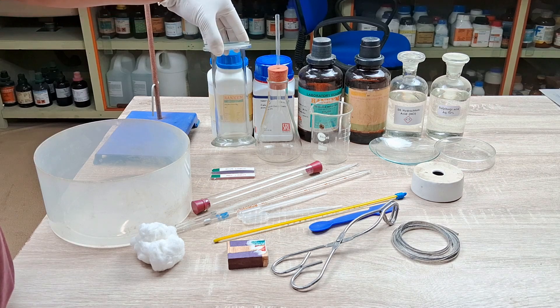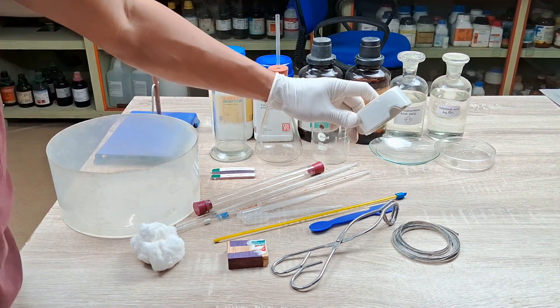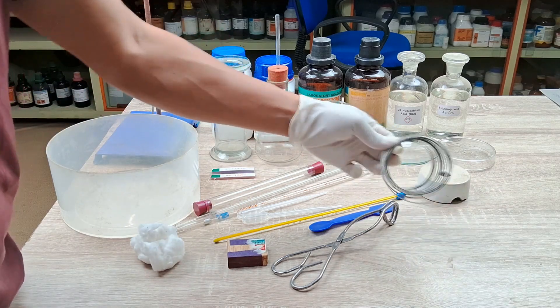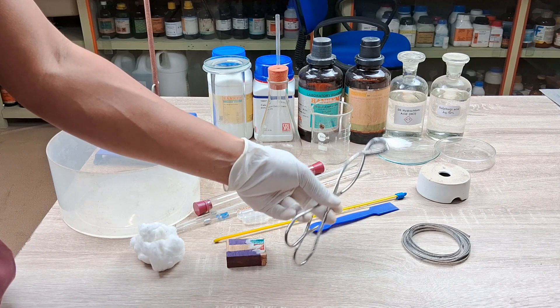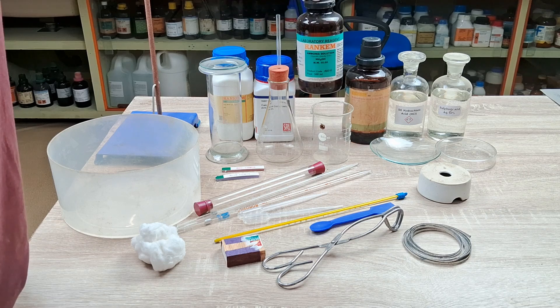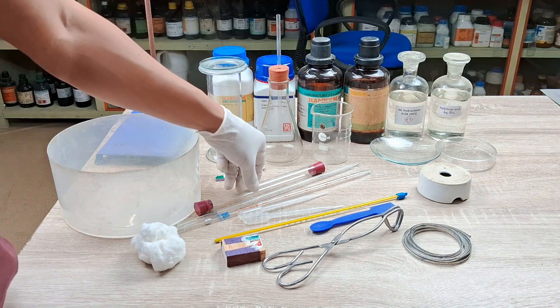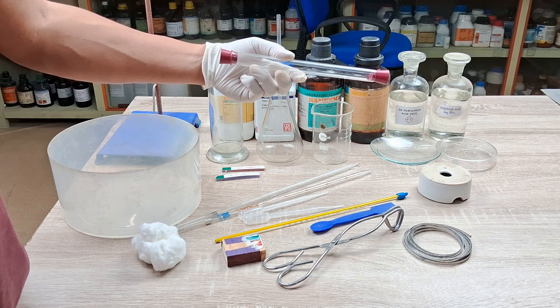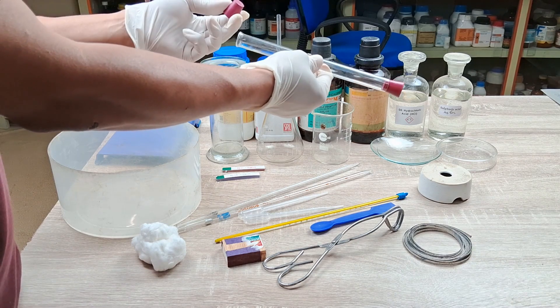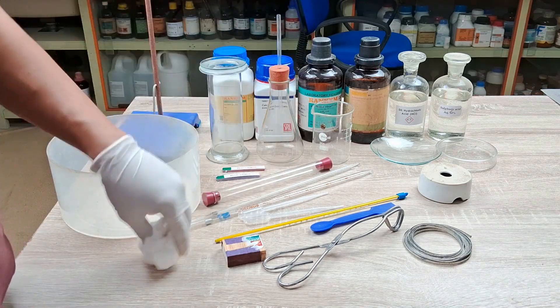A gas jar with glass lid, a pneumatic trough, a beehive shelf, a matchbox, magnesium ribbon, a pair of tongs, red and blue litmus papers, concentrated ammonia solution, concentrated hydrochloric acid, a cylindrical hollow glass tube about 20 to 30 cm long with both ends open, two rubber corks to fit in the mouth of the cylindrical tube, and some absorbent cotton.